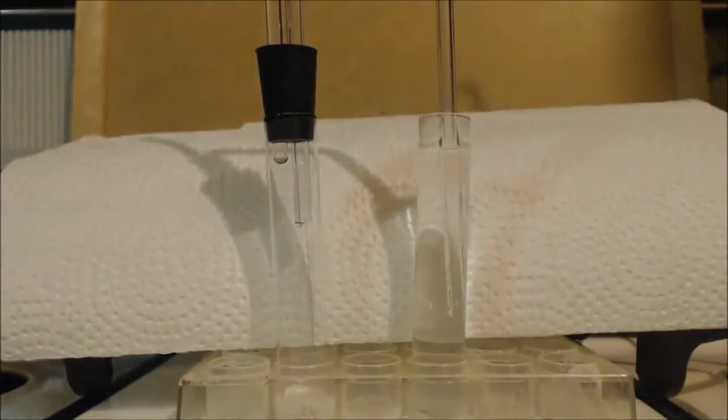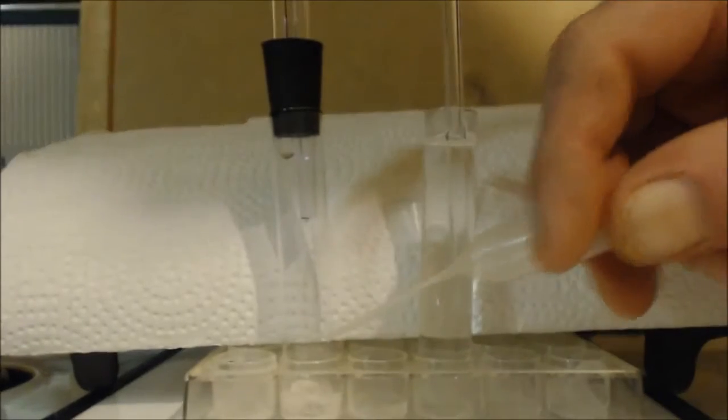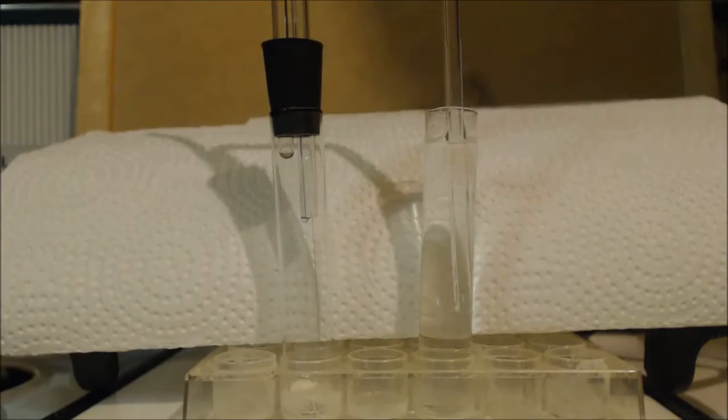On the left there where you got the stopper, you can see up here, this is a dead end port right here coming up. This first one, you can see there's two coming out of there. One on the left is a dead port. The one on the right leads to the other test tube, and it has sodium bromide inside there. Sodium bromide salt, aqueous, meaning it's in water. On the left, you got some calcium hypochlorite.